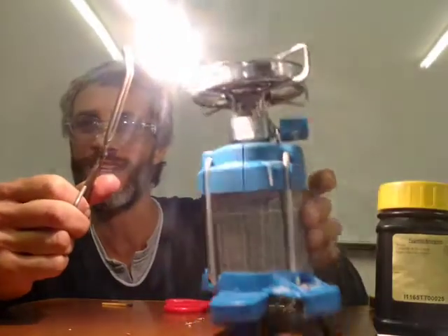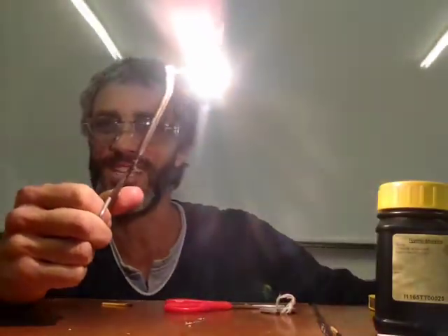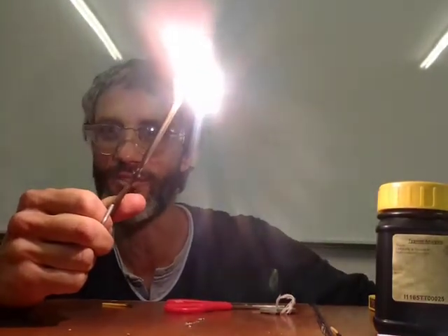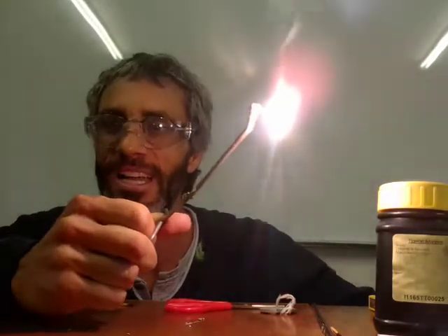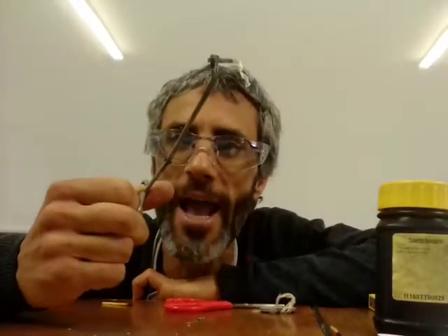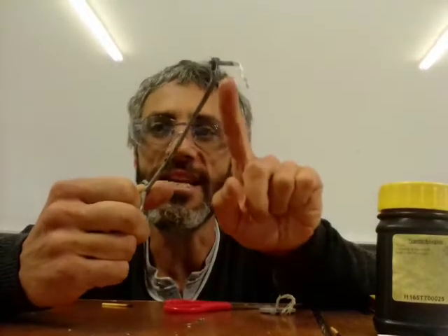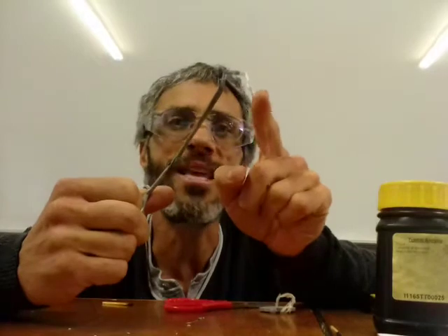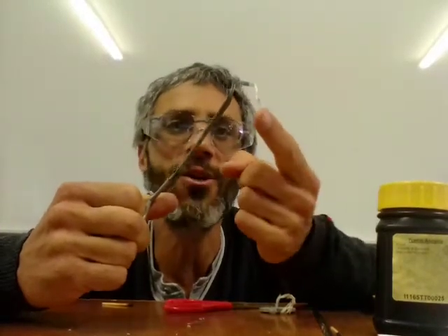Okay, and that should show you that it's not the gas that is doing it. You can see how bright it is. This bright light and the heat that it gives off as well, I can tell you, I feel, is a sign of a chemical reaction. There's a chemical reaction happening with the magnesium strip. You see here, in this bit, it actually didn't do anything. But here it reacted with oxygen and created this powder.